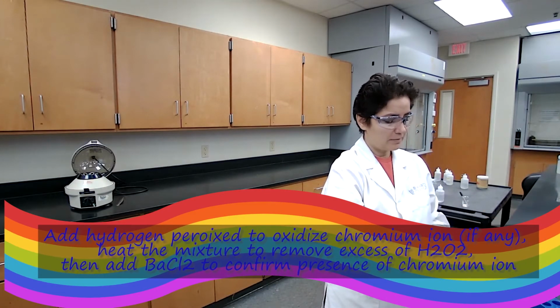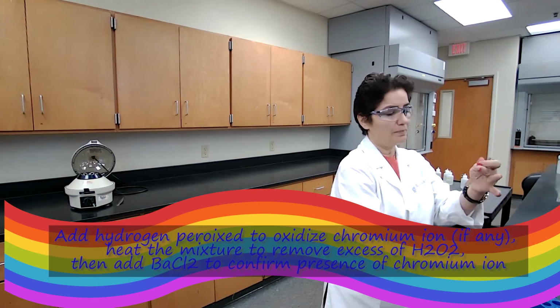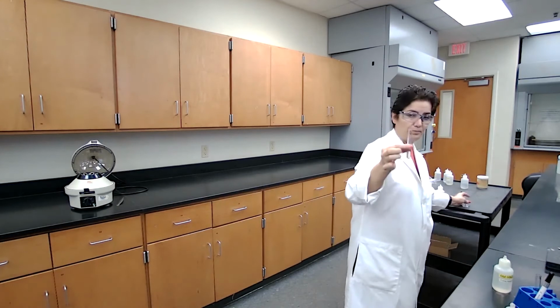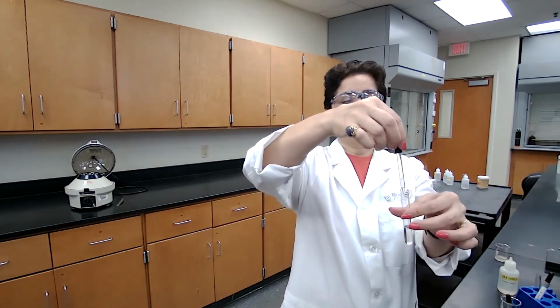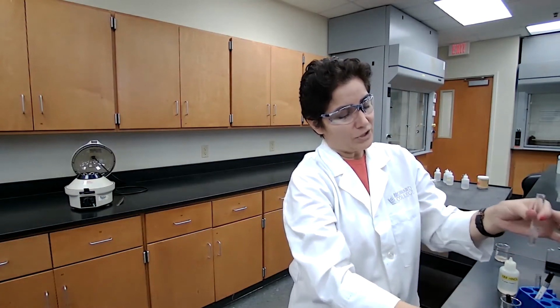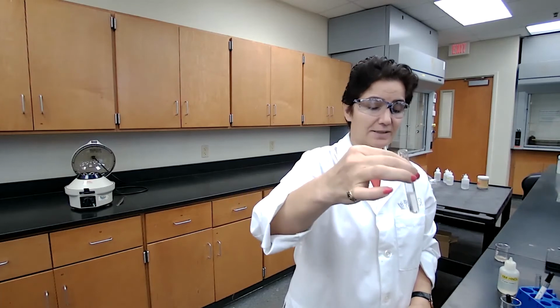For part B, or test tube B, that I have saved from previous steps, I'm adding the hydrogen peroxide, a drop or two, to make sure that if I have chromium 3, it is oxidized to chromium 6.